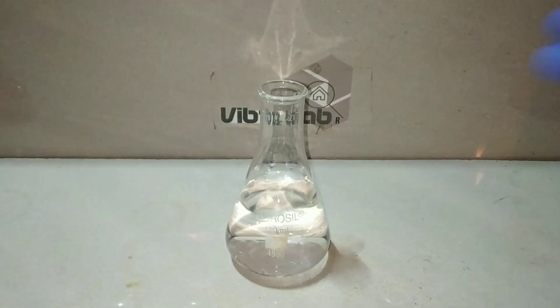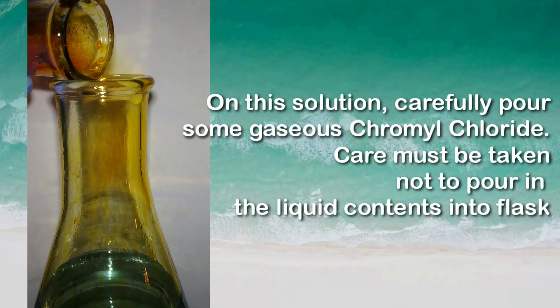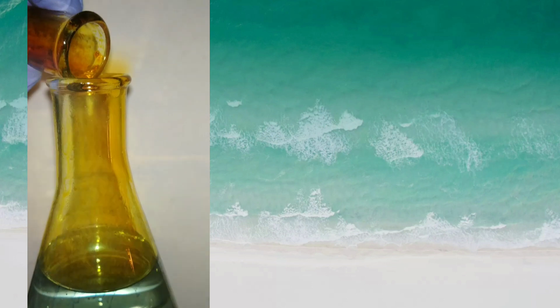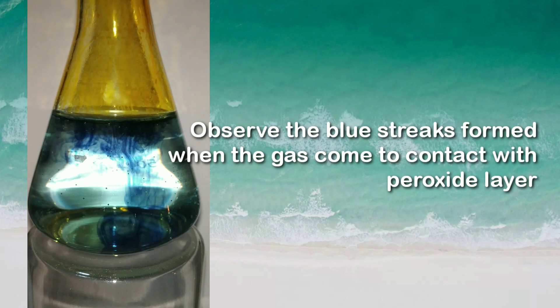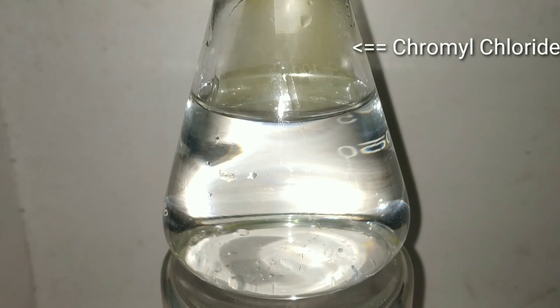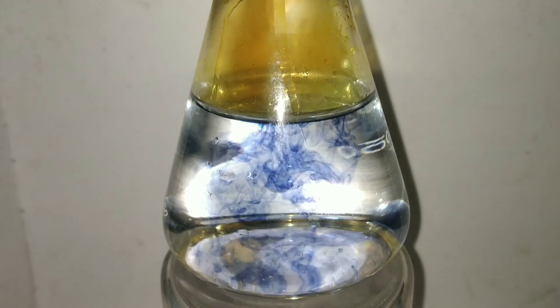Now we are going to pour the chromyl chloride vapors into the solution we just prepared. Observe the air-fluid level — you can very well appreciate the formation of beautiful blue colored streaks into the liquid layer. Care must be taken that we are pouring only the vapors into the flask; the solution itself should not enter. You can see that on touching the fluid level, blue streaks are formed.